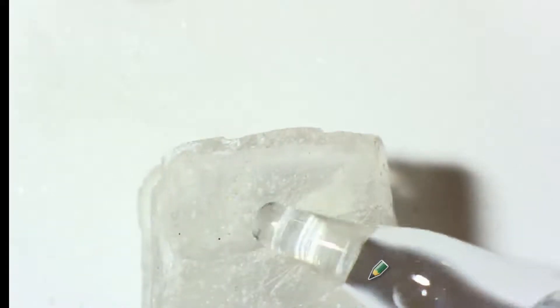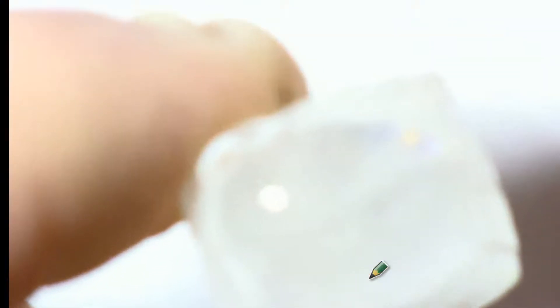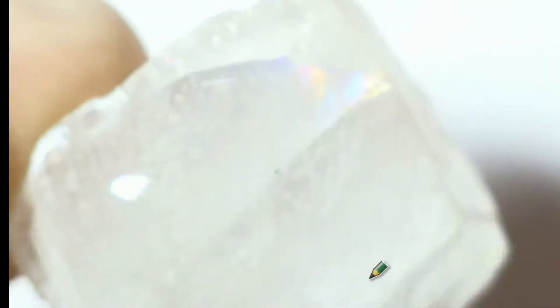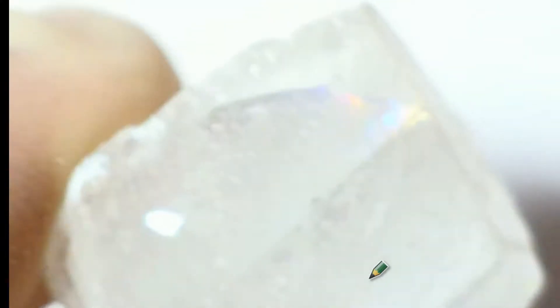Let's test this one now. Let's test the calcite. Drip it on calcite. And we'll wait. Let me move this underneath. Zoom in a bit closer. Don't worry, I'll fix it. I know it's blurry. I can see it. Now, if you look closely, we do have some bubbles forming. You can see them. They're little round circles. Can you see them? It's not fizzing as much as it did on the limestone, but we do have some bubble formation. Can you see them? The little dots? Let me try to brighten it up a little bit so you can see it better.